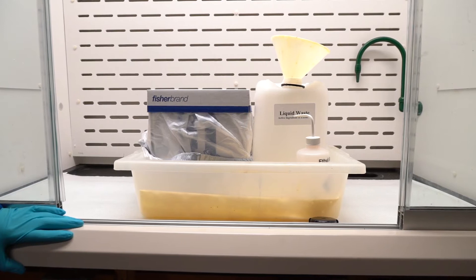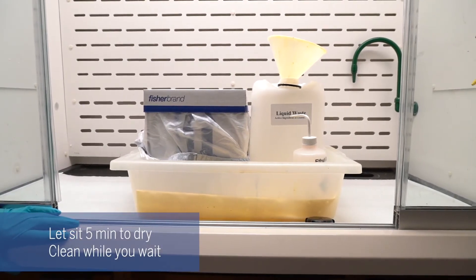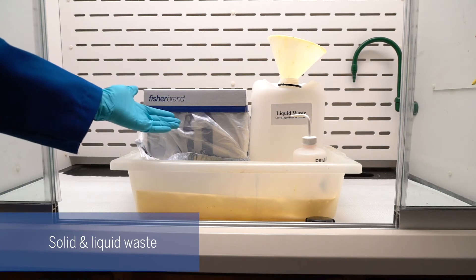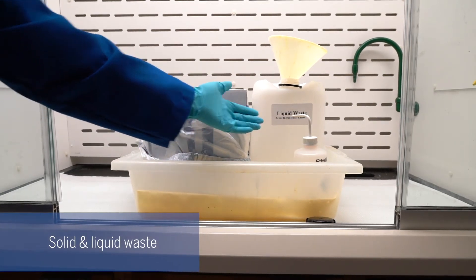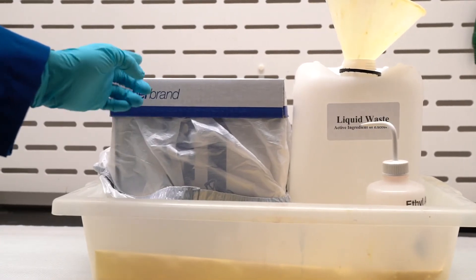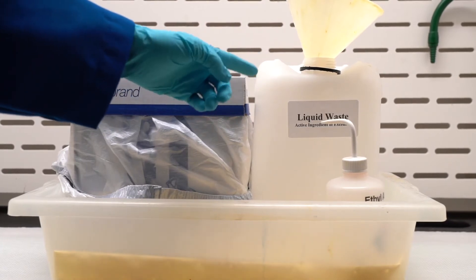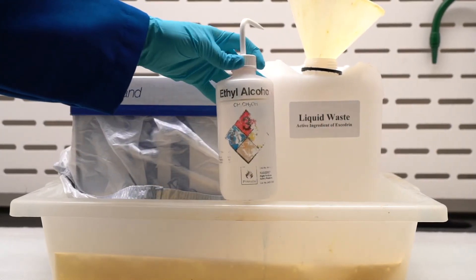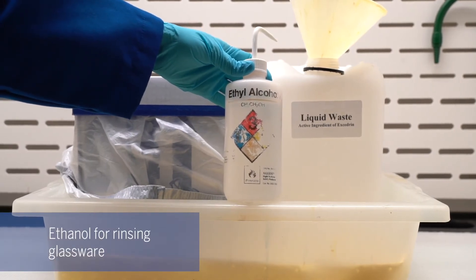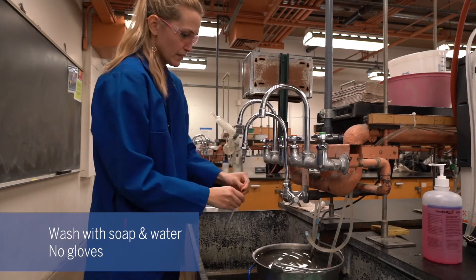While we're waiting for our organic layer to dry, or during any other downtime, it's always a great idea to start cleaning up. Here we have a close-up of our solid waste box and our liquid waste box. Solid waste is where we'll put the pH strips, any glass pipettes, and liquid waste will go in the liquid waste container. You can rinse your containers after dumping the liquid into the waste — rinse them with just a little bit of ethanol, then wash everything in the sink.